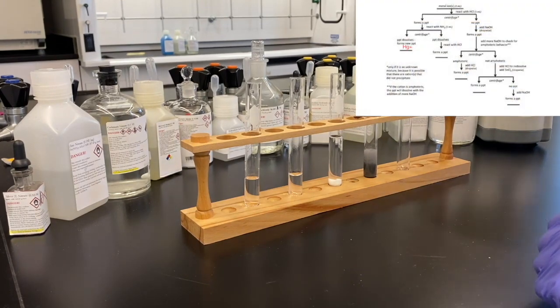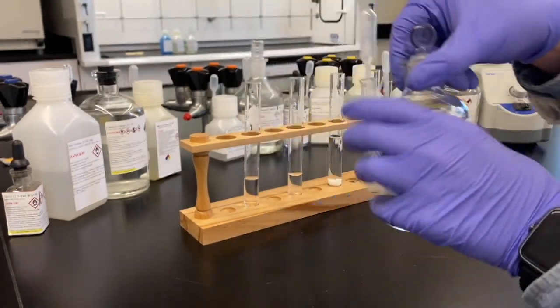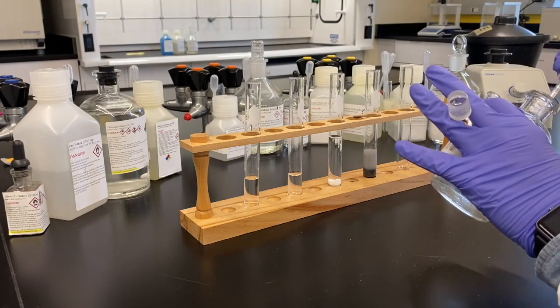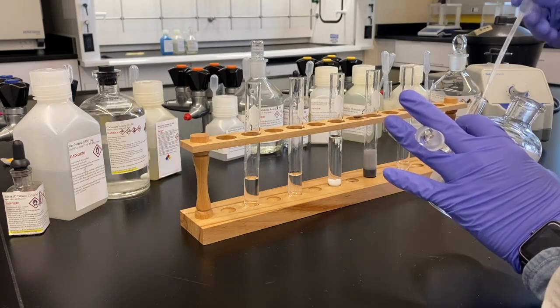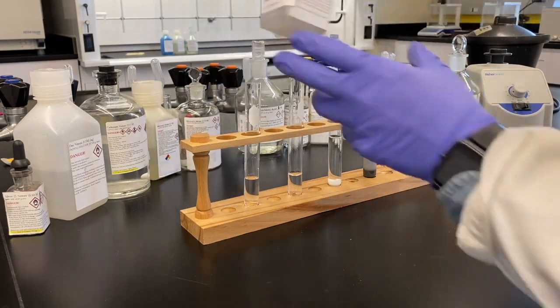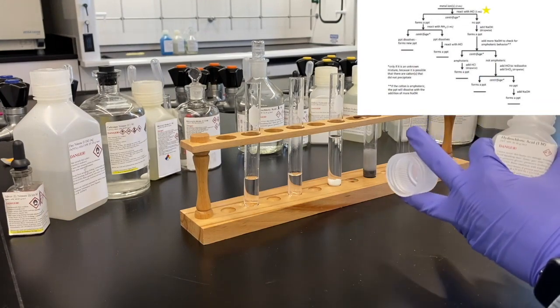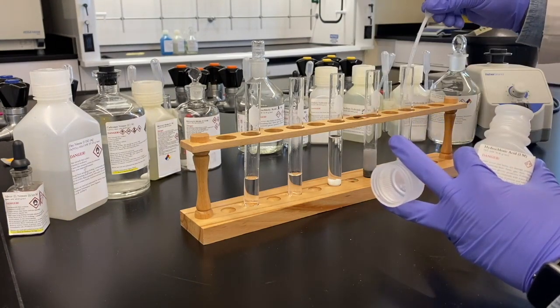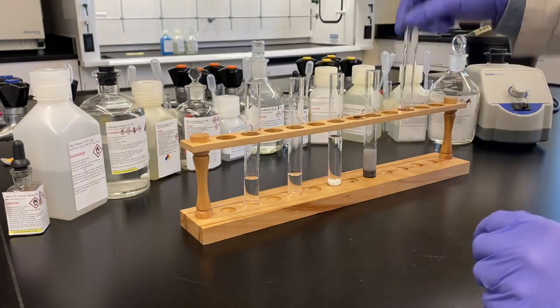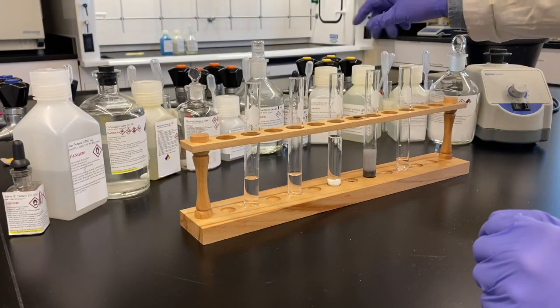We'll talk more about the mechanics of each reaction at the end of the procedure here, as we're just kind of blasting through this procedure. We're moving through it pretty quickly. Mercury 2 is what we're on to now that we've placed mercury 1 on the far left side of the reaction tree. We're doing our first addition of acid. Again, keeping that concentration lower so that we don't have so much work to do in neutralizing it later. No precipitate forms when acid is added to mercury 2.